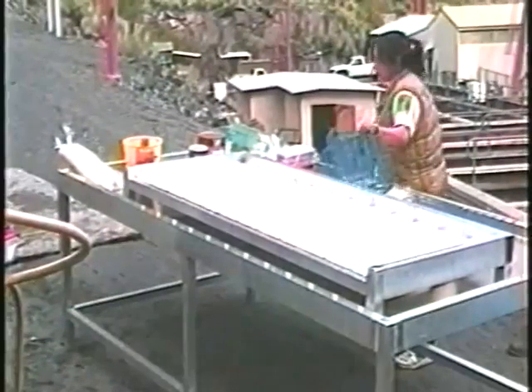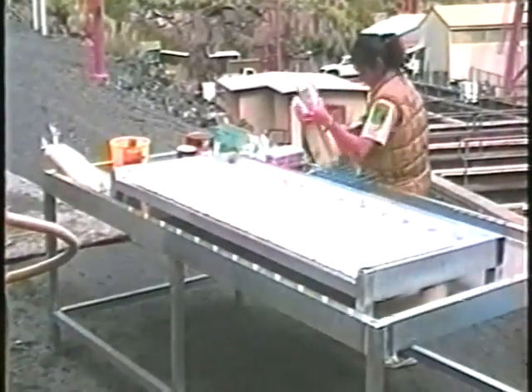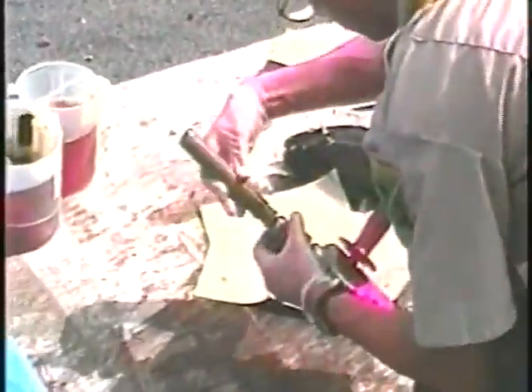methods. Whether the necropsy is done in the field or the laboratory, a clean working area is required. In the field, this may simply be a board or table with clean paper towels.